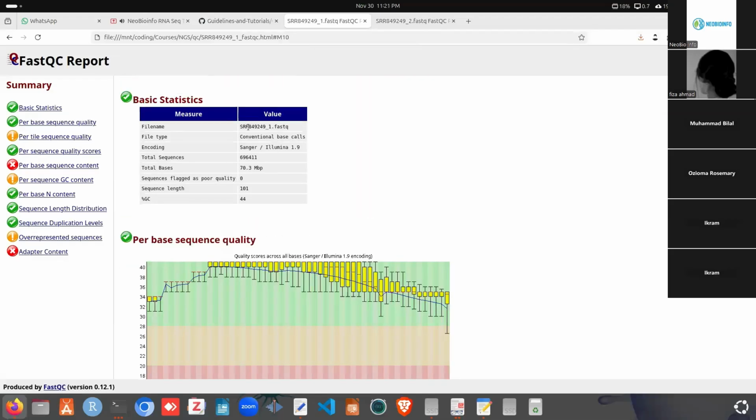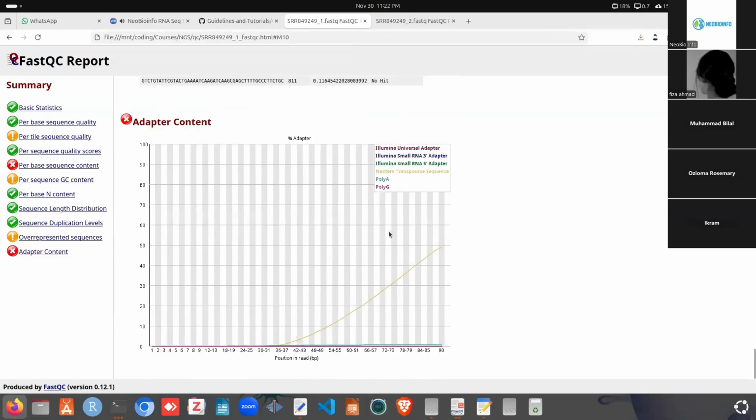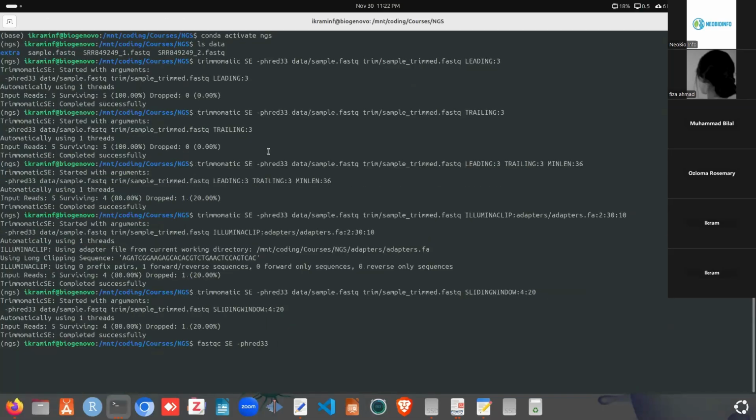That was our original document, so we can see what we need to fix. In per base sequence content, we can see it has some fluctuation. Trimmomatic, that is trimming, won't actually fix this, so what we need to do is entirely crop this sequence, and for the adapter content we will use the adapter file that we have. We are performing this.